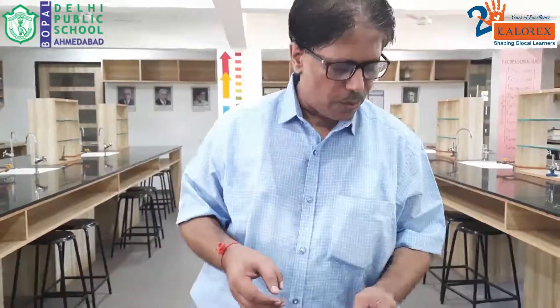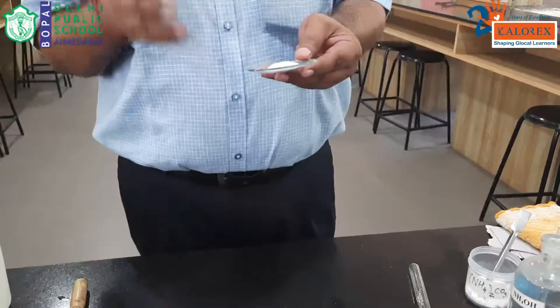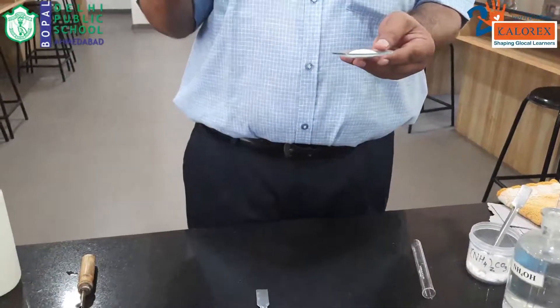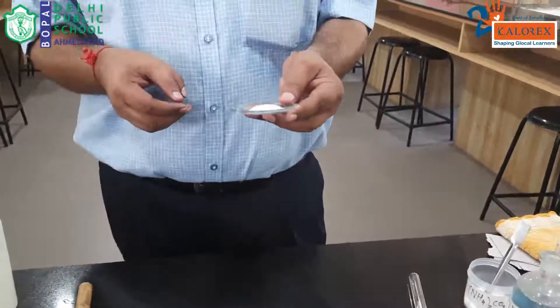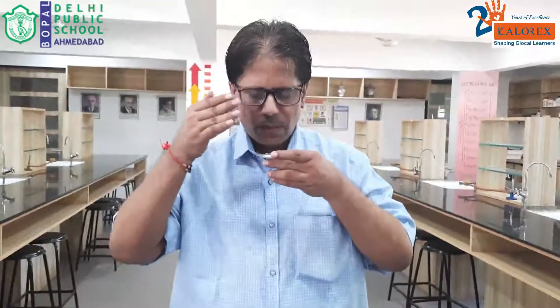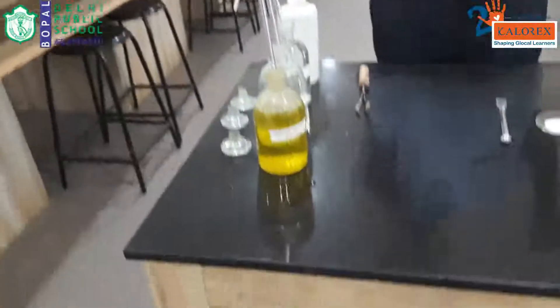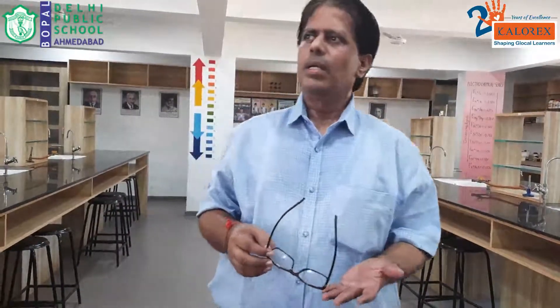The first preliminary test observation: the salt is a white crystalline substance. When it is white, obviously Cu²⁺, Ni²⁺, Fe²⁺, Fe³⁺, Co²⁺ — all those colored ions are absent. You can write this inference. Then you can check the odor of the salt. No smell is observed. We have two types of smell: ammoniacal smell indicates NH₄⁺ ion, and vinegar-like smell indicates acetate ion. Neither is observed here.